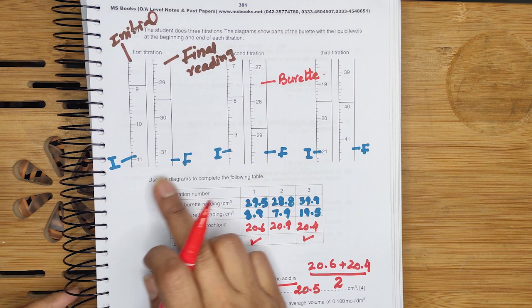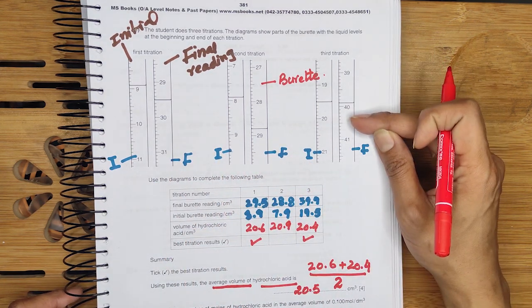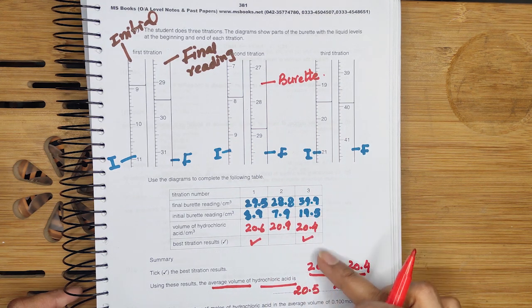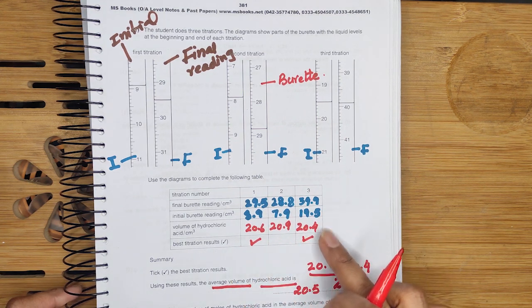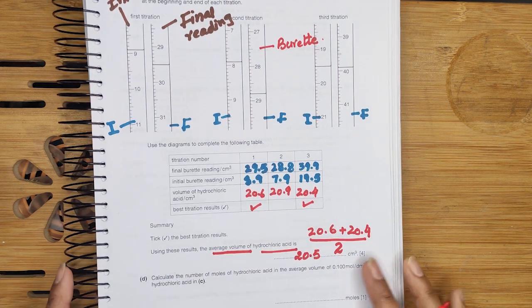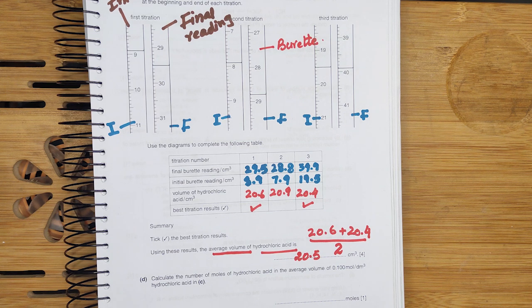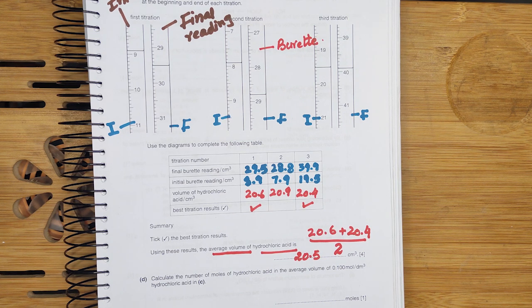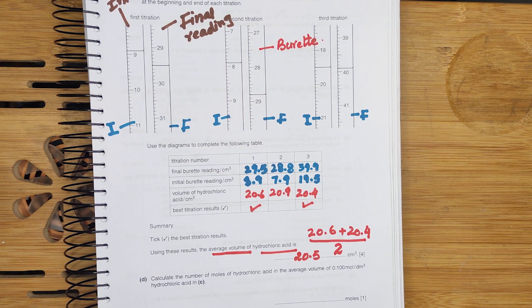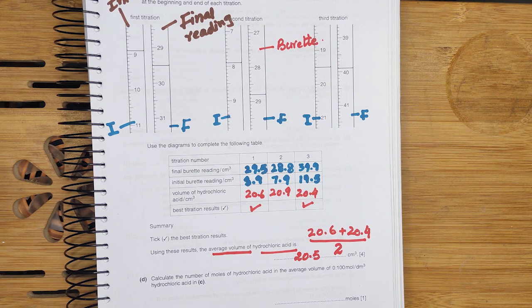This is the way through which you will get the burette readings and record them in the table. You will find the difference between the volumes, identify the best results, and get the average volume of hydrochloric acid. I hope you have learnt it very well — practice these titration-based questions. Consistency is the key of success. Signing off, Miss Aisha Mansoor.